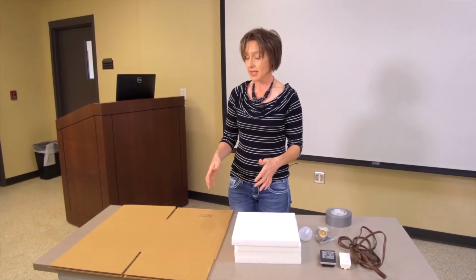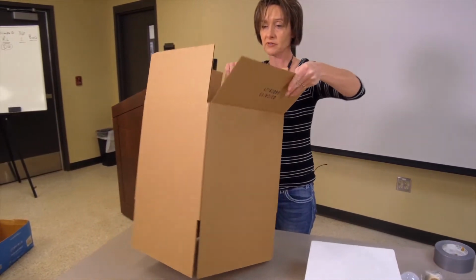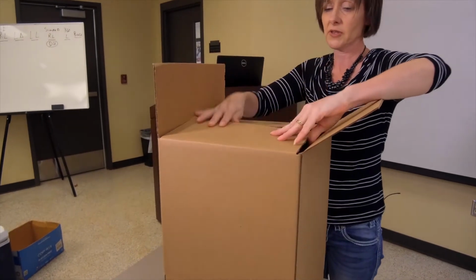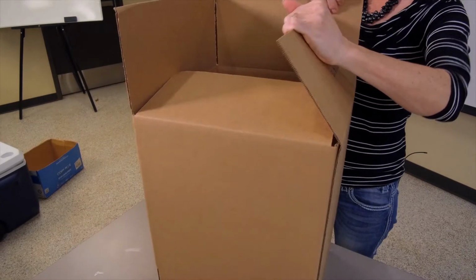So we're going to go ahead and put our box together. This particular box is 12 by 12. The dimensions aren't critical. It's just so that we essentially get our pieces of styrofoam to fit within there.